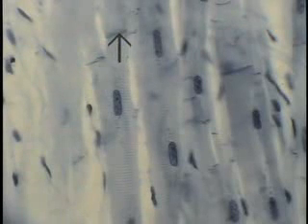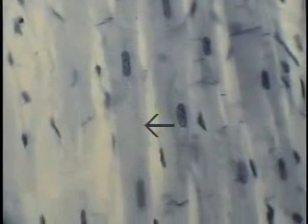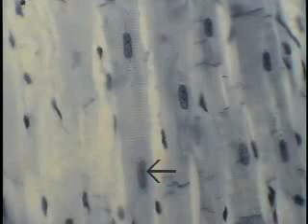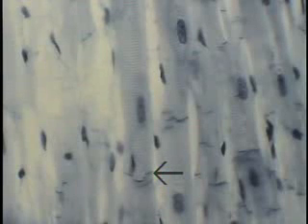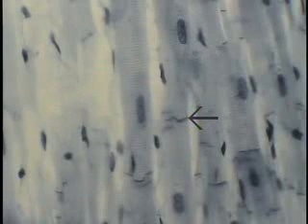An intercalated disc is located at this location. Another is shown here. If one continues down this particular cardiac muscle cell, one can appreciate this particular one is binucleate, a rather unusual occurrence, the second nucleus appearing here, and then finally the intercalated disc where it joins another cardiac muscle cell located at the end of the pointer. Another intercalated disc from a branching fiber on this particular side of the field is shown here.